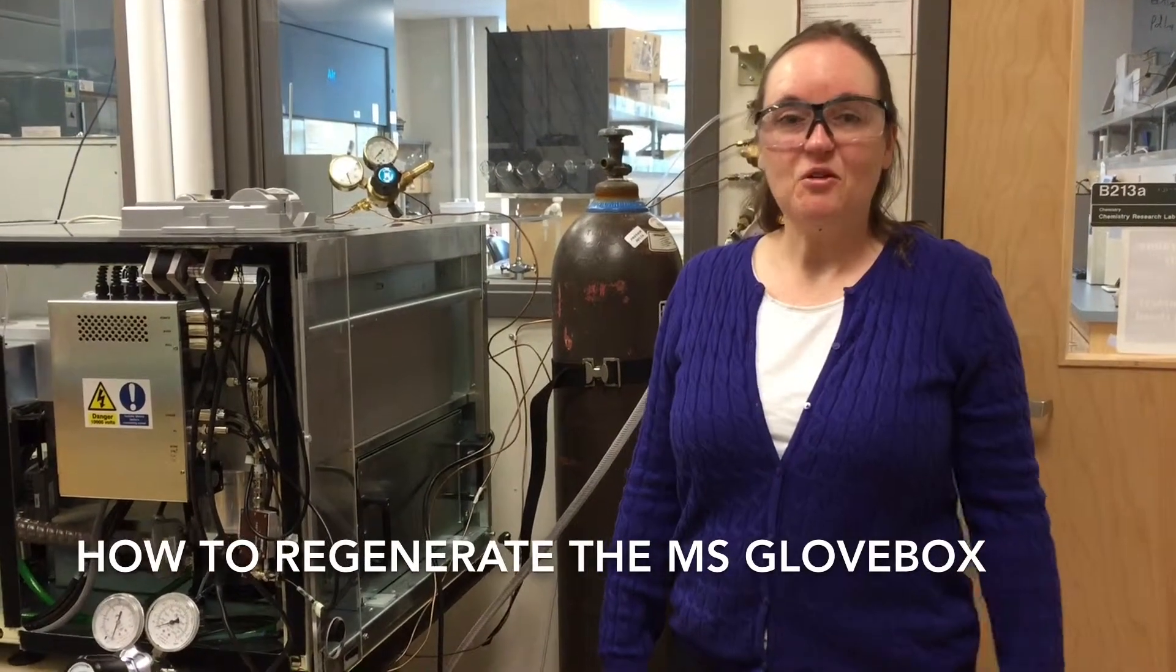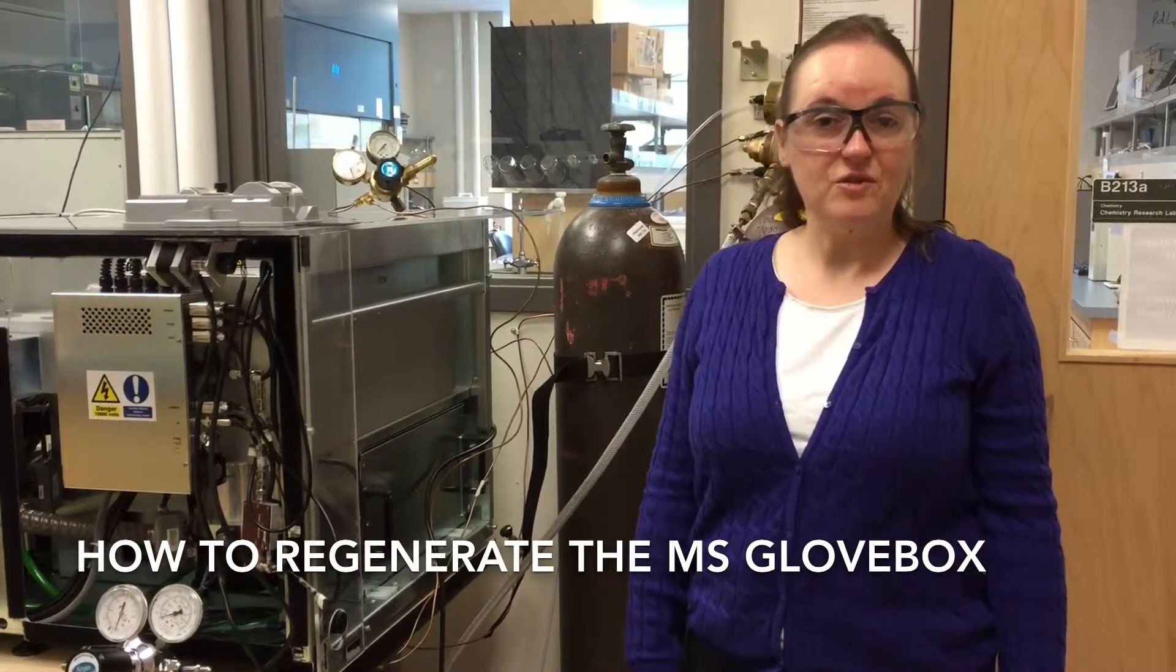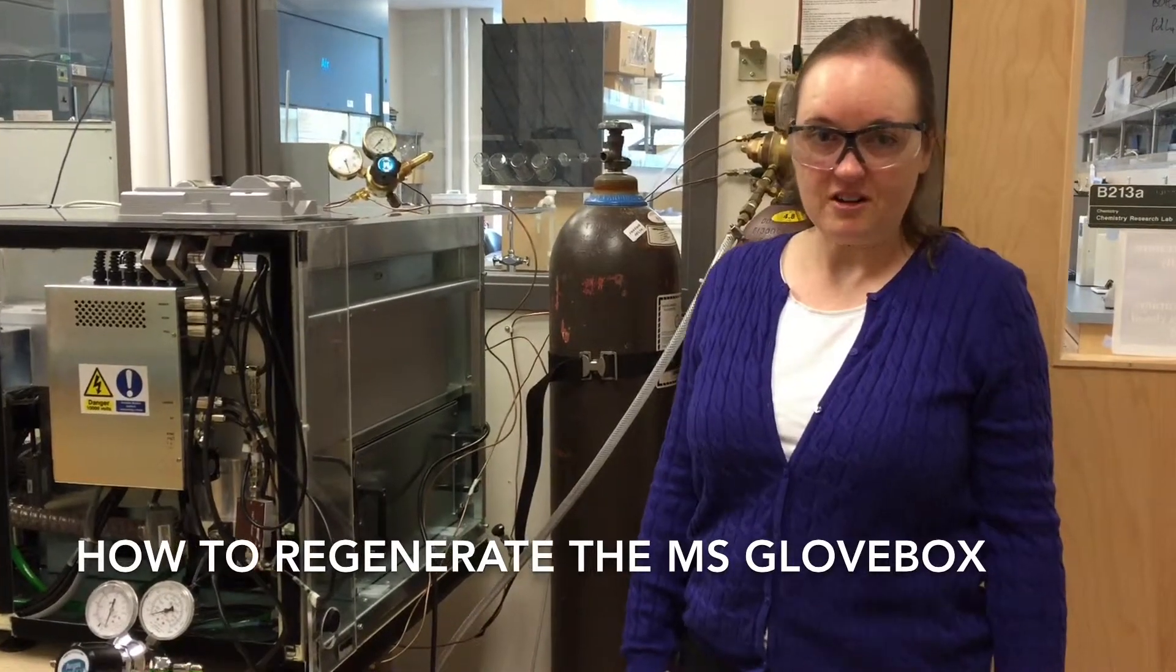Hello. Today I'm going to talk about how to regenerate the small glove box.